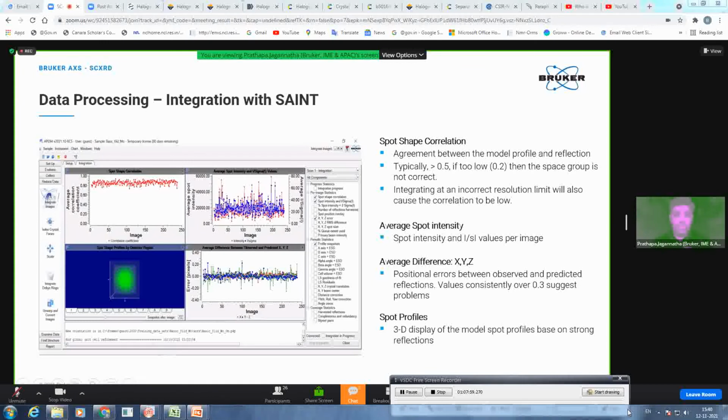So that means on each frame, what is your reflection quality and the sigma of it. If you are constantly getting the right values, 20,000, 30,000 counts, then you know you are getting a good reflection in each image, nothing has affected. If there is a sudden drop, then you know either the crystal has moved out of the beam or maybe something has happened during the measurement. So always look at this profile.